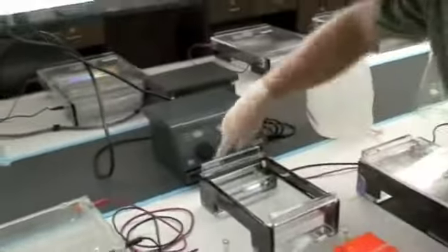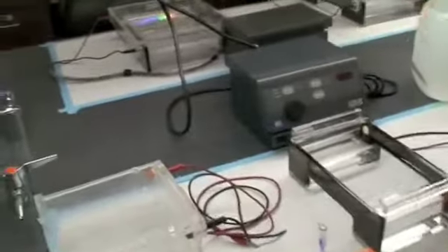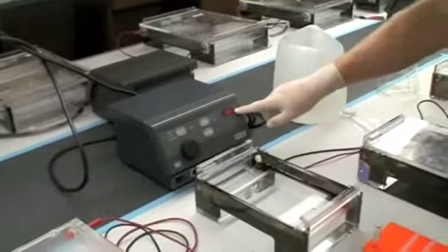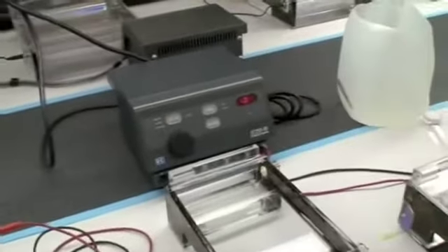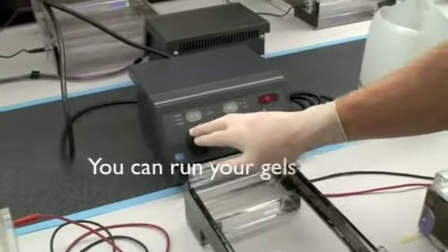We turn on the, there's actually a hard off and on switch right here. Zero and one. So now this comes on. It says it's at a hundred volts. We'll run it at a hundred volts. Maybe actually we'll run it at about ninety.